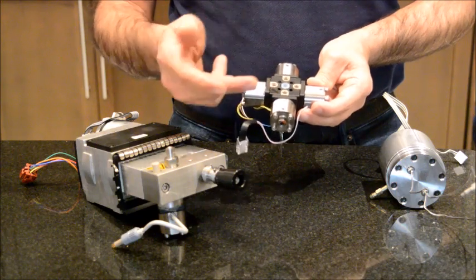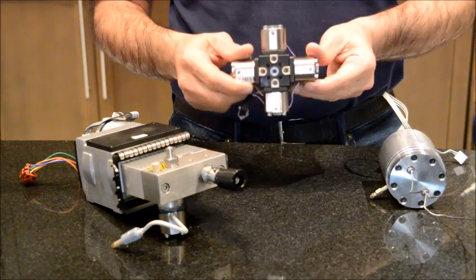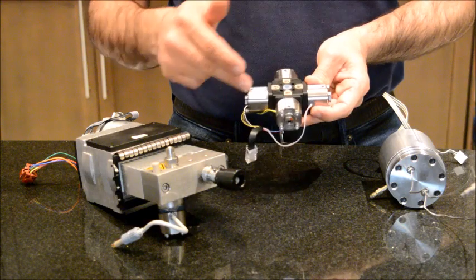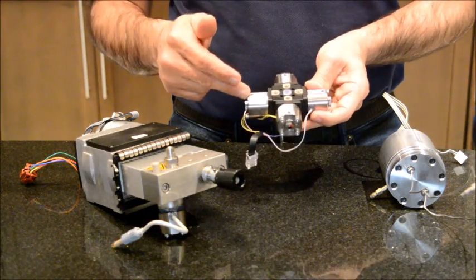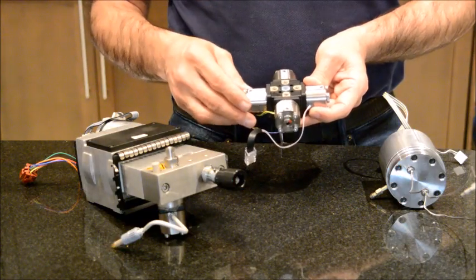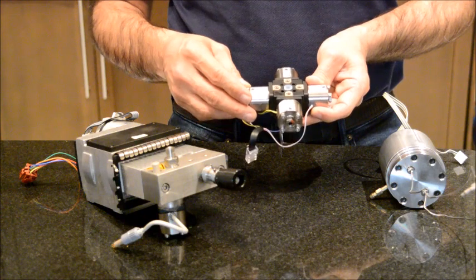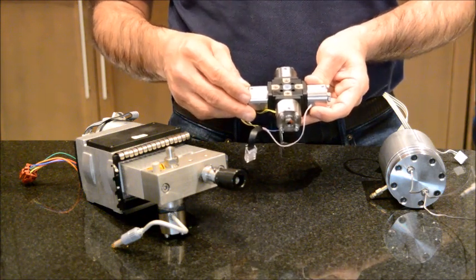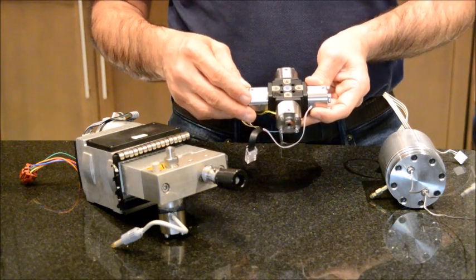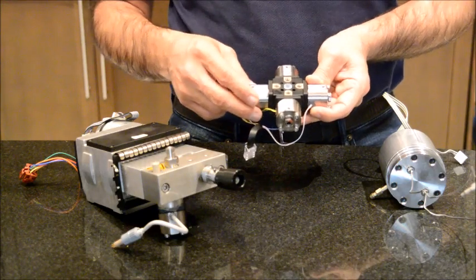But before I do that, for the troubleshooting or resolving your problem, you are not going to open up the gradient proportion valve. What you're going to do is wash the unit. Get rid of all your mobile phases, replace with water, maybe warm water, wash it overnight if you have to. Switch to 50 percent IPA, then switch back to 100 percent IPA, and the component inside will regenerate when they are exposed to the isopropyl alcohol IPA.